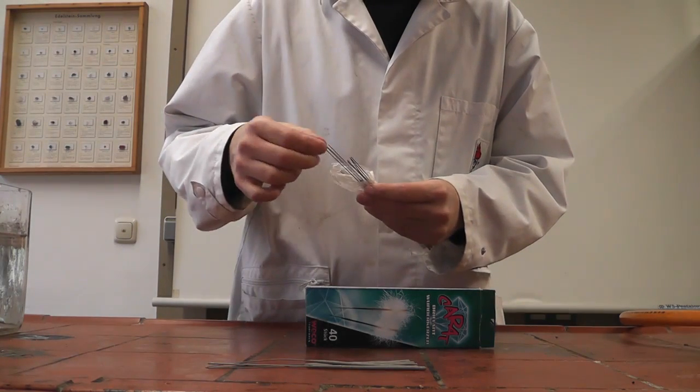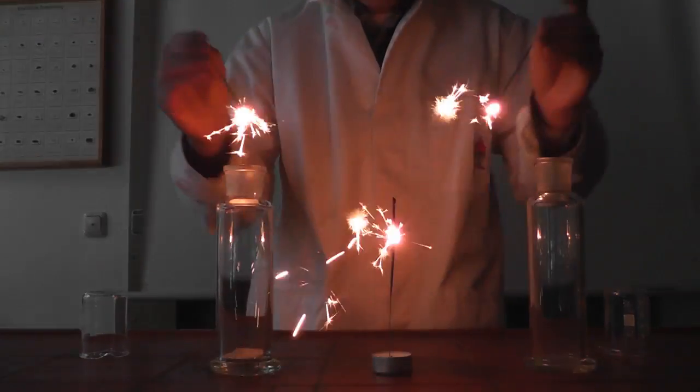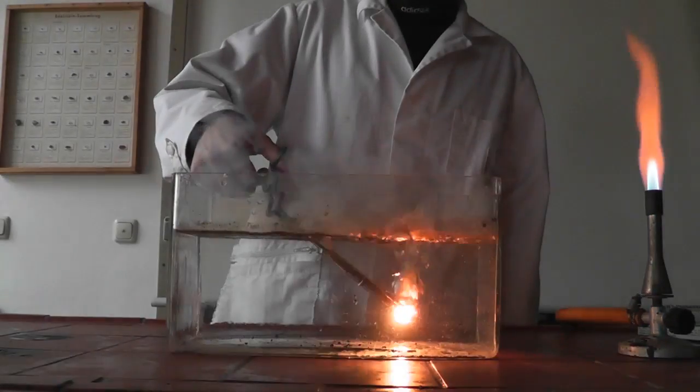Sparklers contain barium nitrate, which gives oxygen on heating, so they can burn in gases like nitrogen or even underwater.